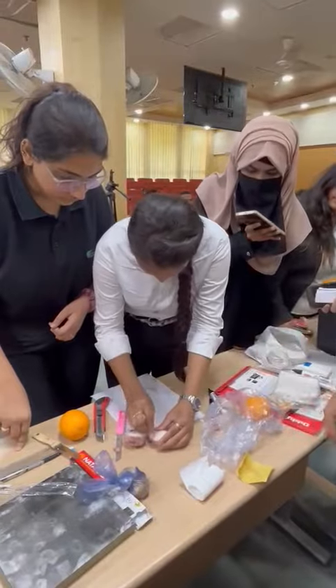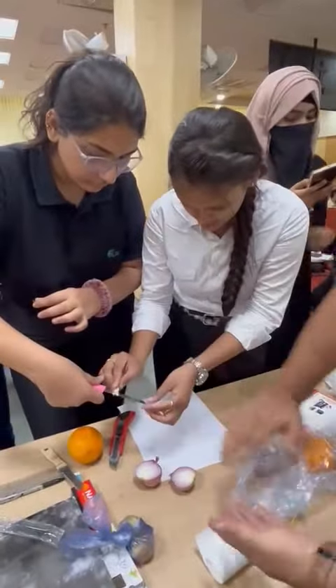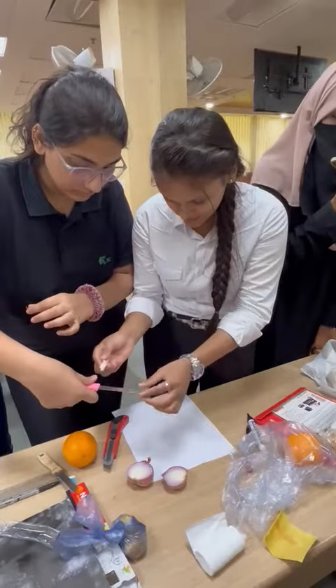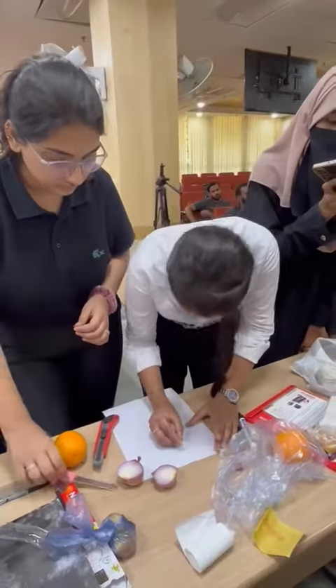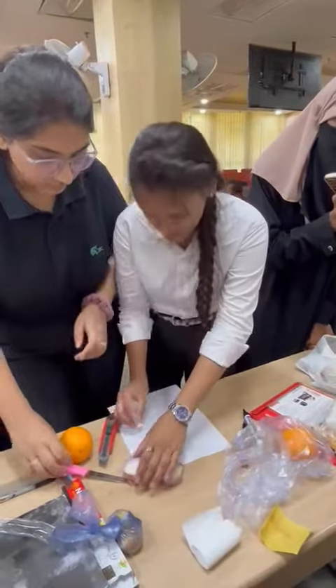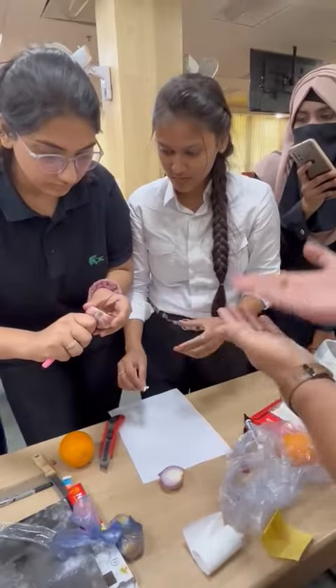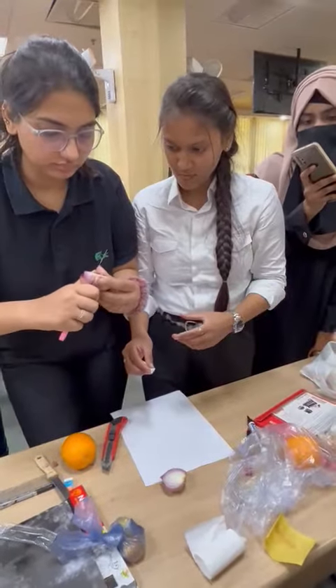A little more. It's a little bit of cotton — one layer with the milk, a little bit. One layer? Get one layer and cut it. Please cut it from between. You will cut it in here. Thank you.